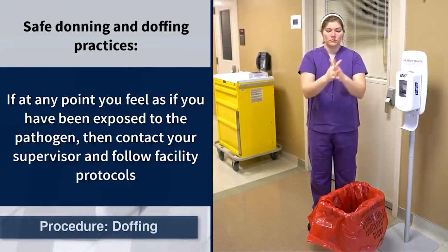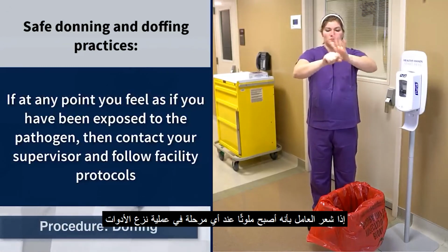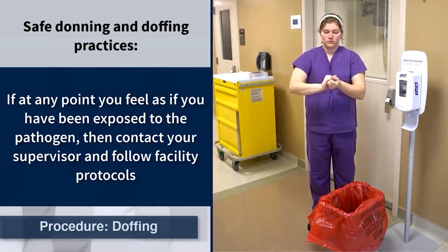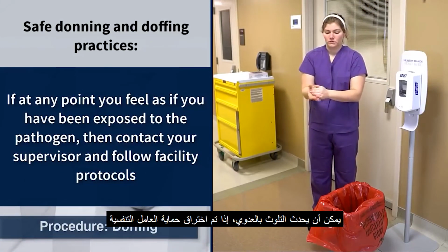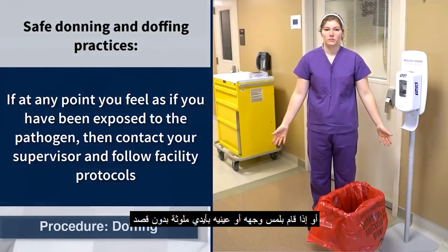If a healthcare worker feels they may have become contaminated at any point in the doffing process, they should notify their supervisor and follow facility protocols. Contamination could occur if the healthcare worker's respiratory protection was compromised, or if they inadvertently touched their face or eyes with contaminated hands.